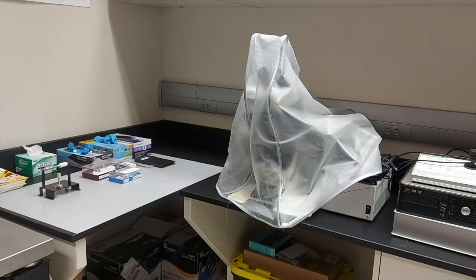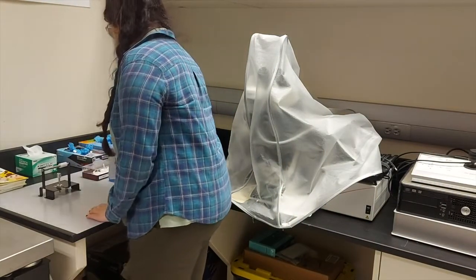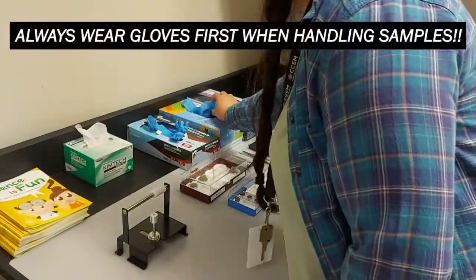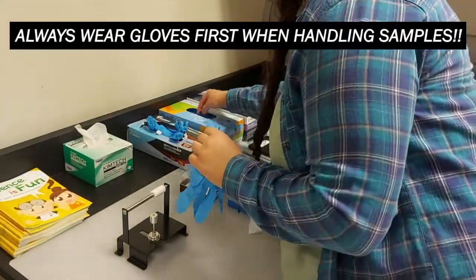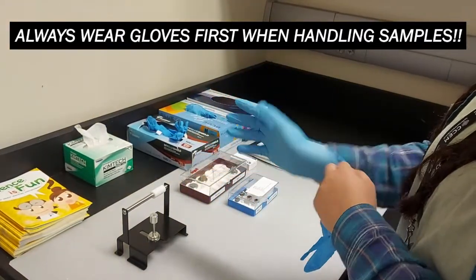In this video we'll walk over how to prepare a sample for observation. The first step is to wear gloves when handling samples. This is very important to avoid contamination.